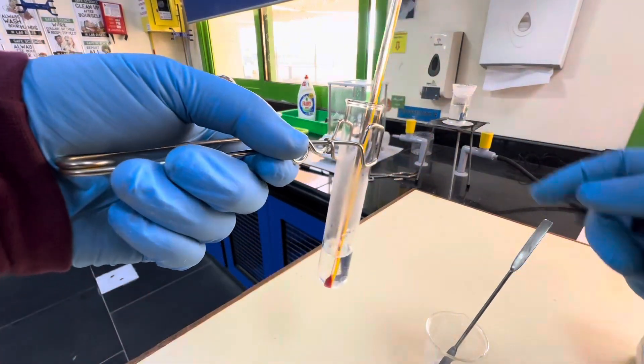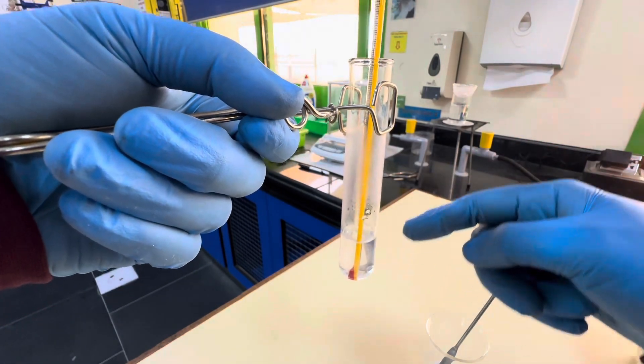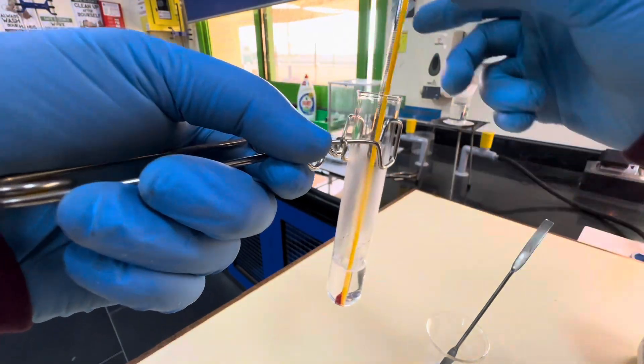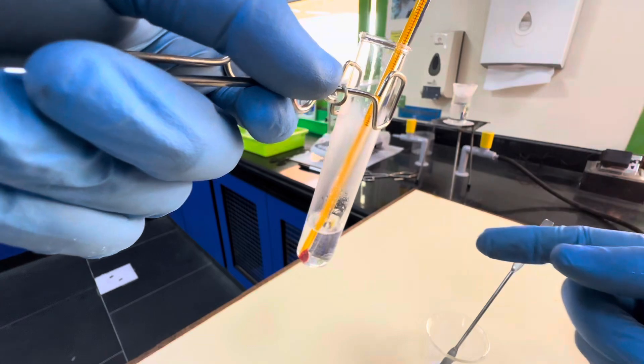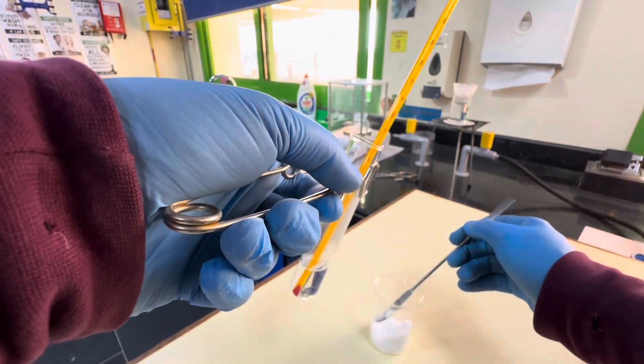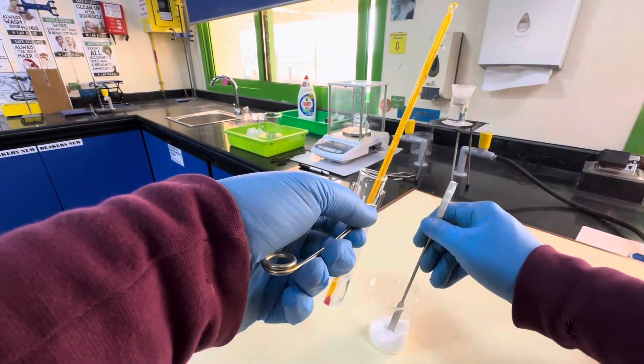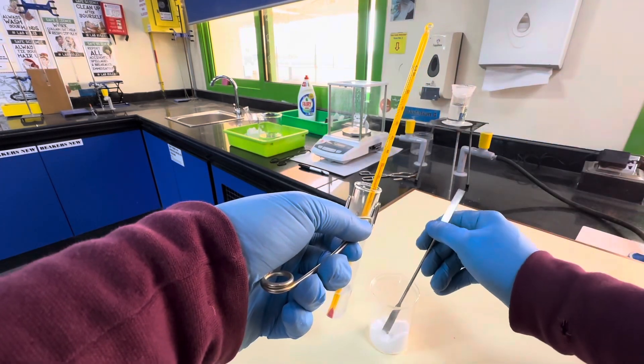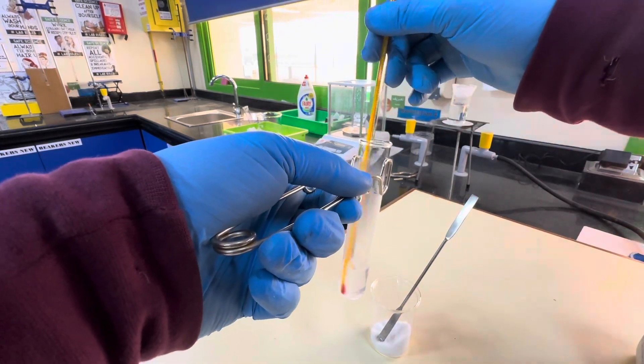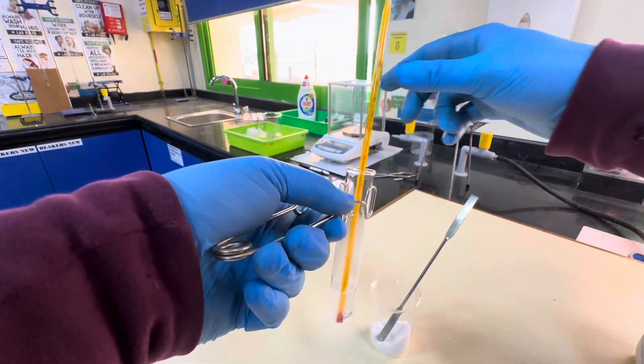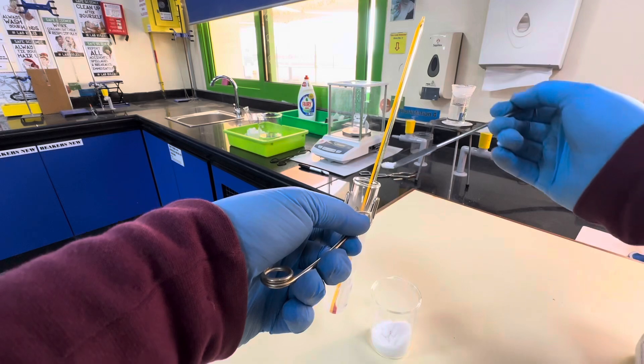I'll throw it in there. Just have to be careful because sometimes there's condensation that forms. This is the distilled water and the crystals will stick to the side but I'll try and push the crystals in as much as possible. I'll keep doing this until either the temperature goes below 40, or it forms a saturated solution. It's staying between 45 and 50 degrees so I'll keep on adding.